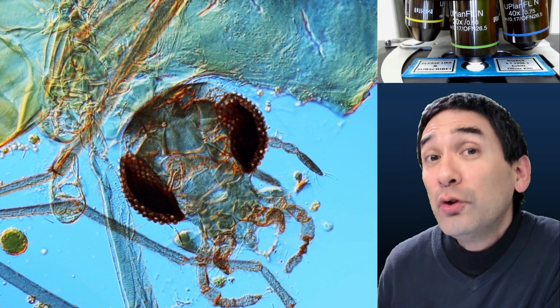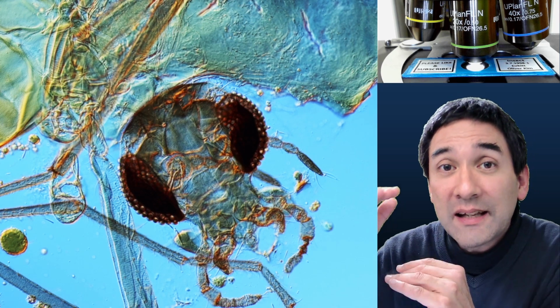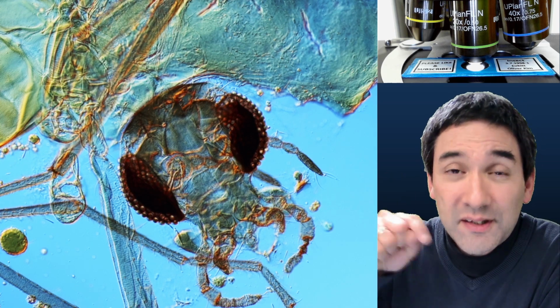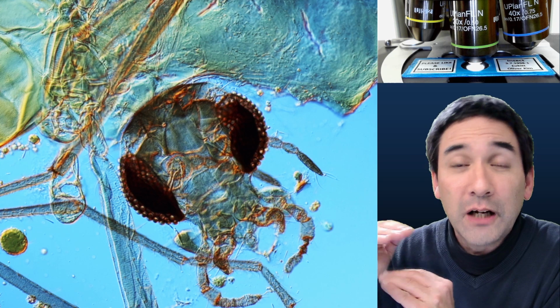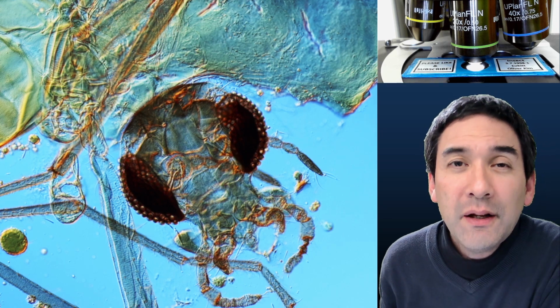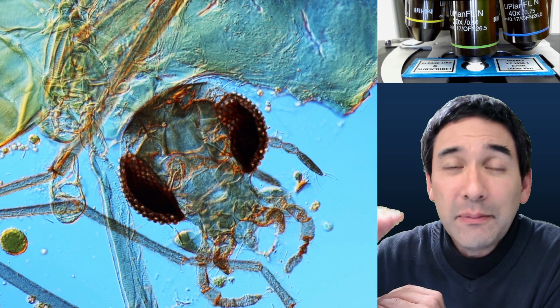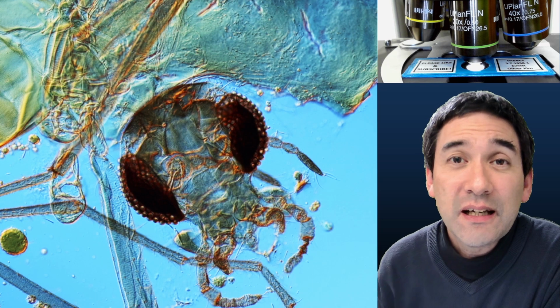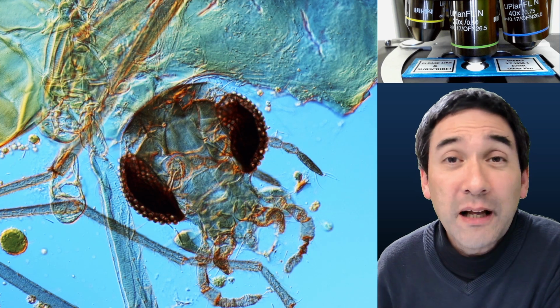A second possibility, if you do choose to mount the whole insect, is to make sure that there is sufficient space between the cover glass and the microscope slide. What I've done is I put the insect directly into the mounting medium, I drop the cover glass on top and I press down on it, and this of course had to crush the insect. I would actually use spacers now to lift up the cover glass a little bit and to give the insect a little bit more space, and probably also use a little bit more mounting medium, even if it takes longer to dry. More mounting medium also means that the cover glass has a little bit more space and is floating a little bit more on top of the mounting medium, and therefore this also gives the insect a little bit more vertical space.